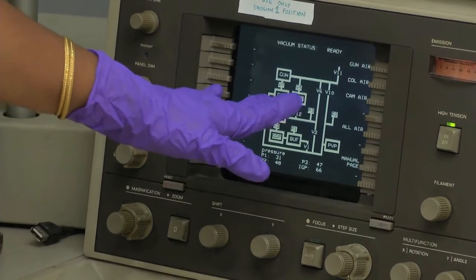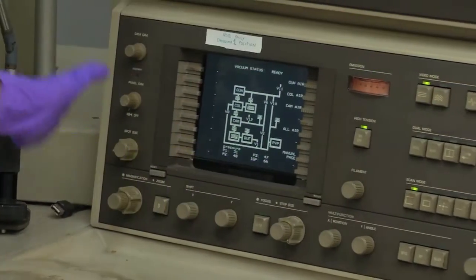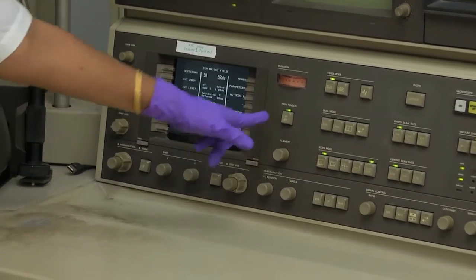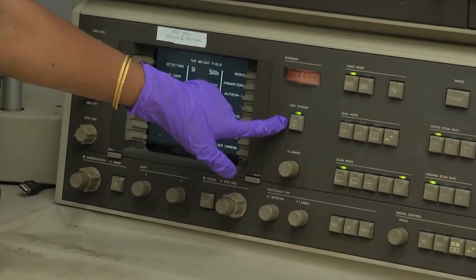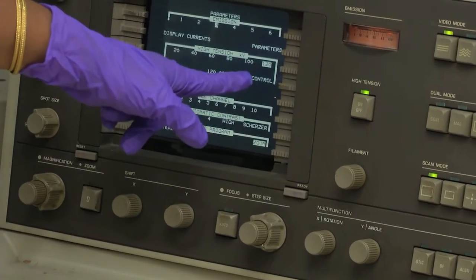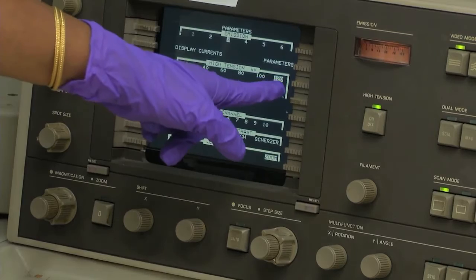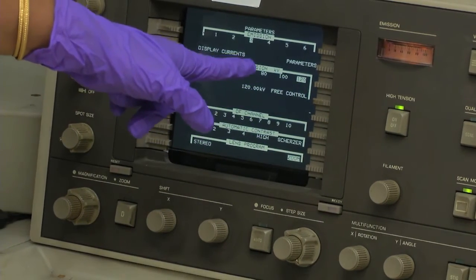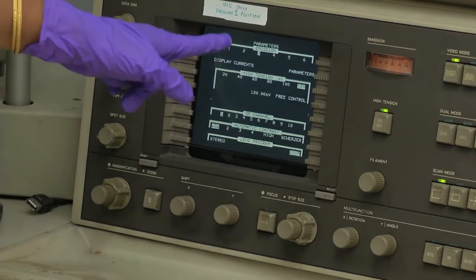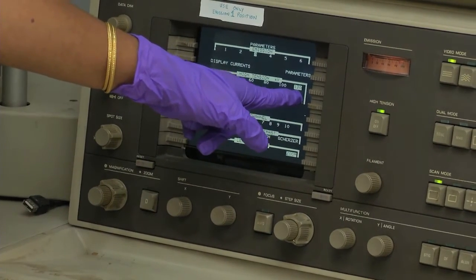The pneumatic valves are controlled using an air compressor. This portion is the control panel. This is the high tension knob — whenever you want to work on the microscope you must switch on the high tension. The selection of high tension is very important and depends on your specimen. In this CM12, 120 kV is the maximum voltage. The resolution is determined by the kV you are using. I have already selected 120 kV.